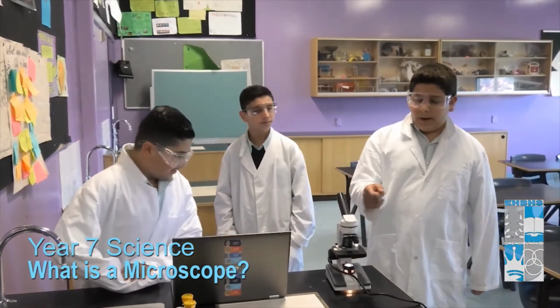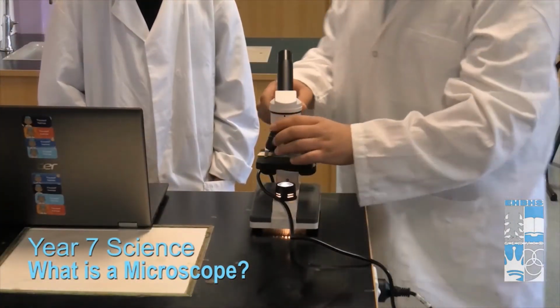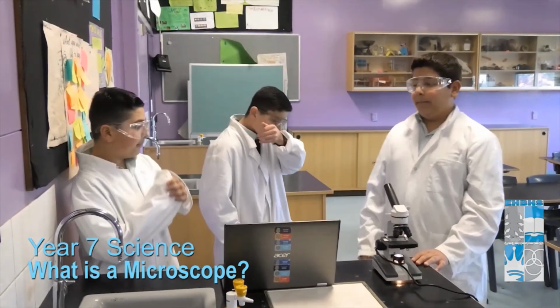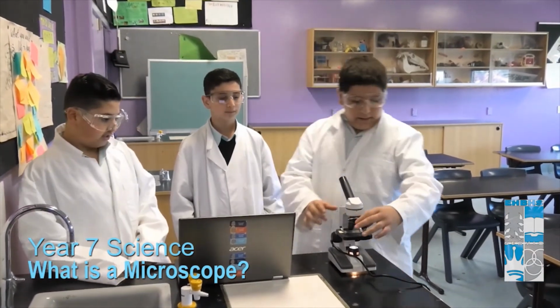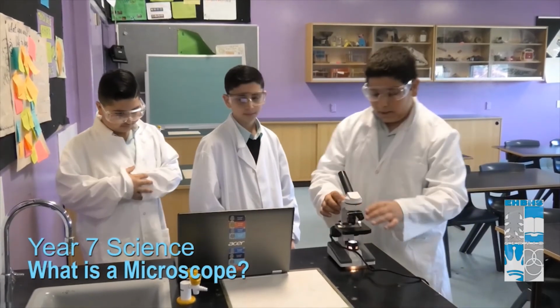Wait, so right now, what's the yellow lens? The yellow lens, I think, is the second biggest objective lens, the times 10. But you have to multiply it by another 10, because you multiply by 10 the number you see here. So right now, the 4 one is times 40. That was a success. So now we check the 100.